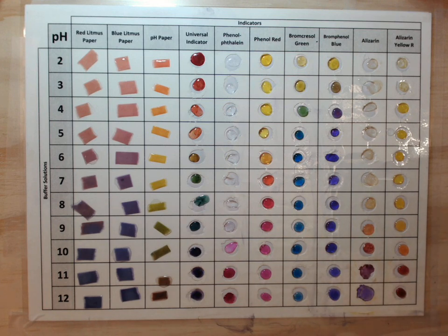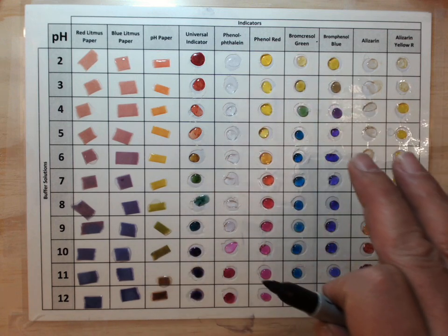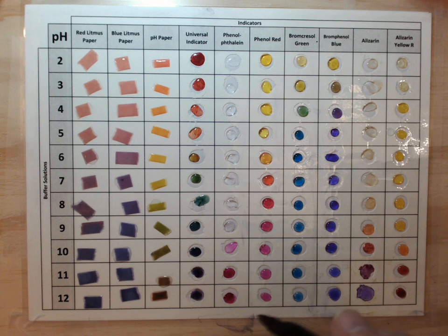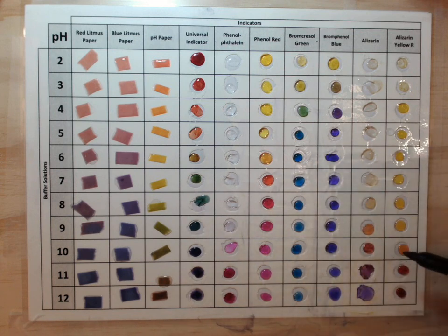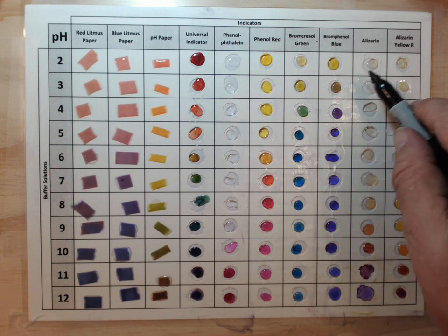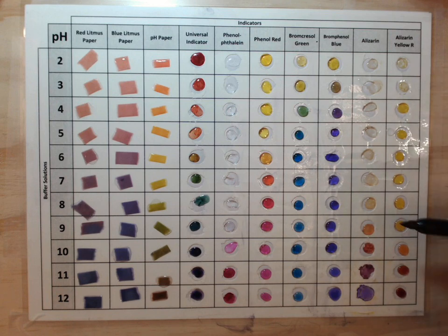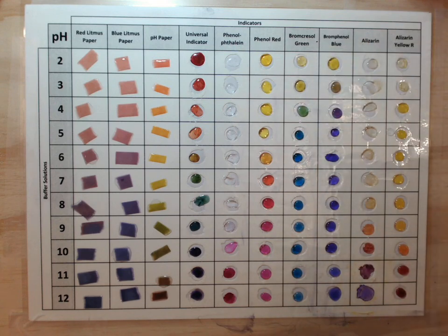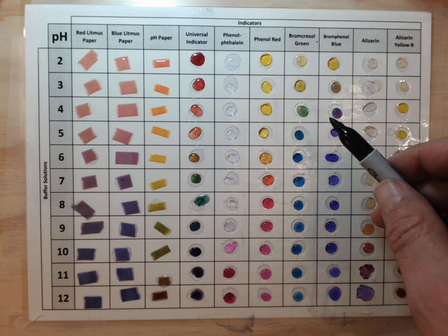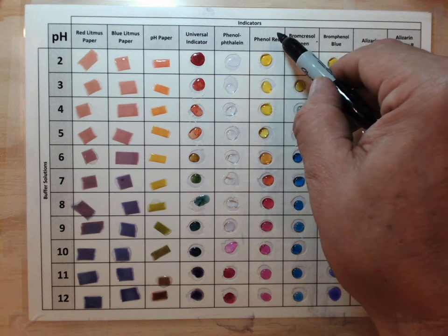Now it's very important to understand that with the wide range of these organic compounds that are available, you can use 2 or 3 to narrow down your pH very well. If you already know that something is in the basic range, you can use compounds like alizarin and alizarin yellow R to narrow down where they are in the basic range. Some of these others change up in the acidic range, but you always need to have a couple of different indicators to tell. So for instance, let's suppose I was testing something that turned phenol red yellow.